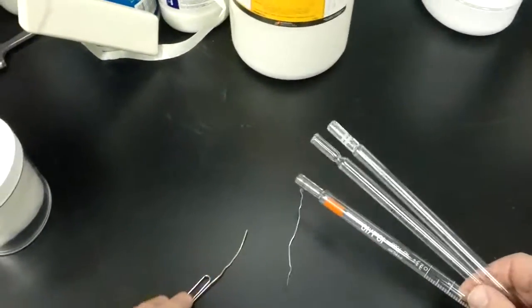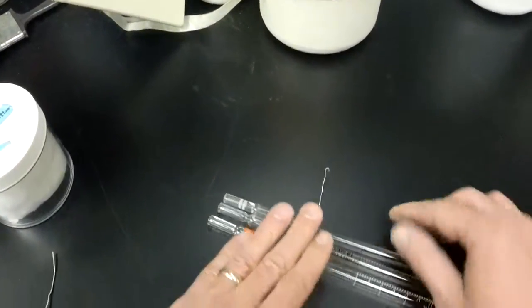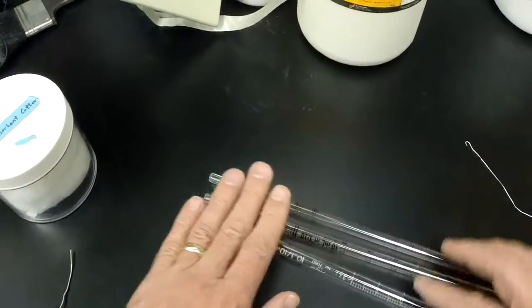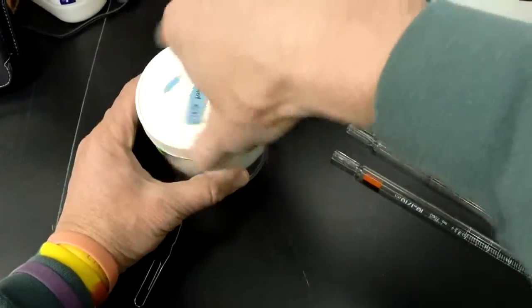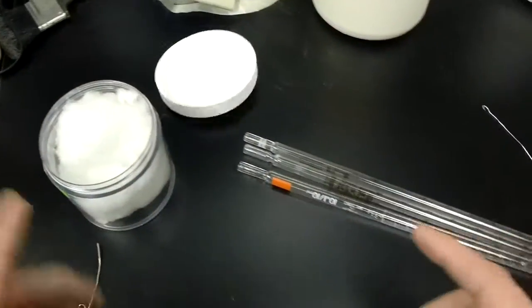To do that, you need to take a piece of non-absorbent cotton. It actually is not a filter.